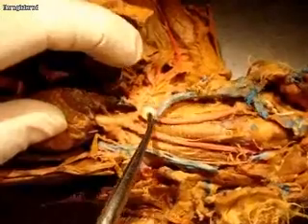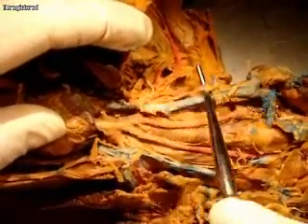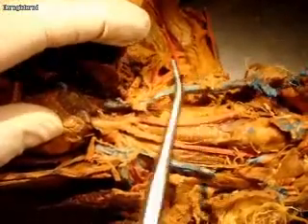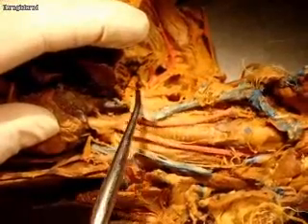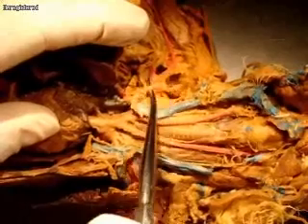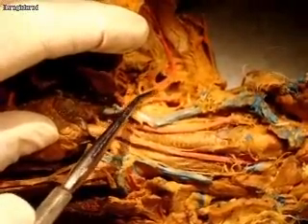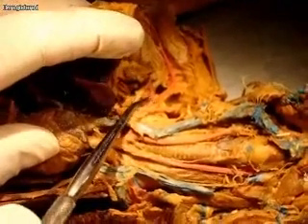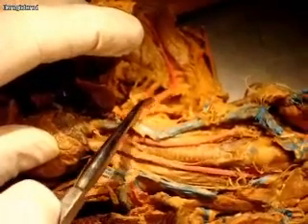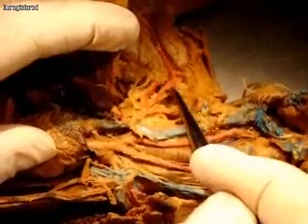The right subclavian immediately sends an artery up called the vertebral artery, and it's really close to what is now the jugular vein. Right after that, you have a thyrocervical trunk. And then it continues a little bit more, and you have these two little branches coming off — this is called the costocervical trunk. And then that continues now as an axillary artery.